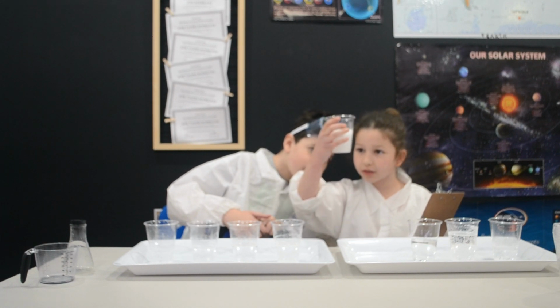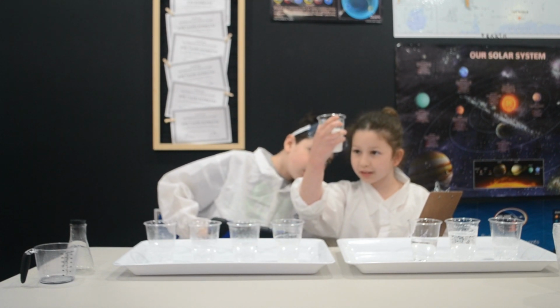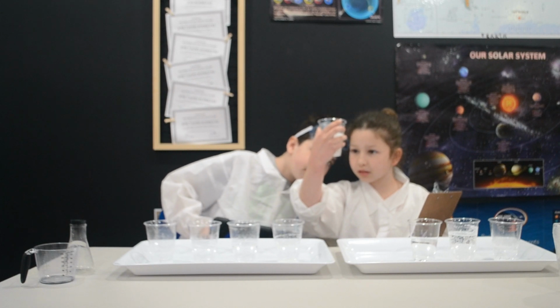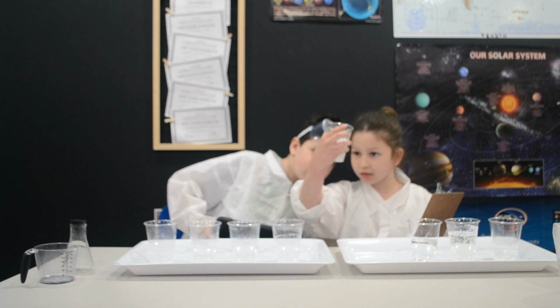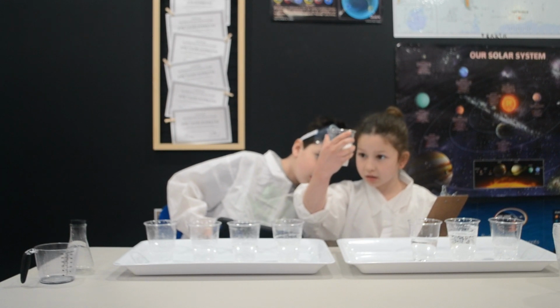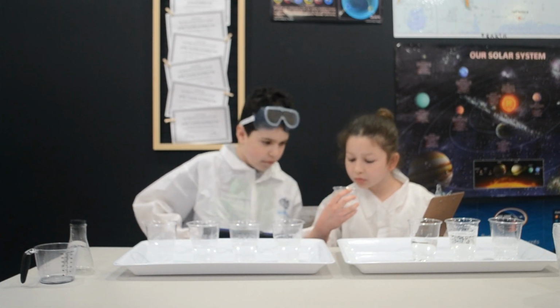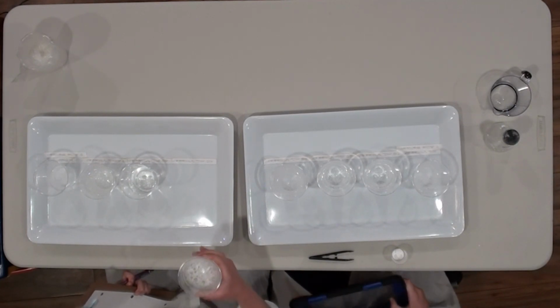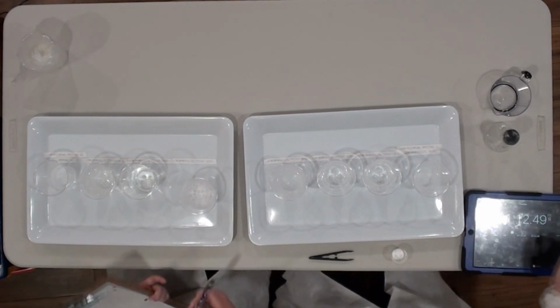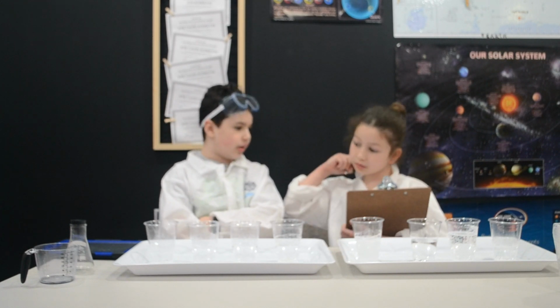It's like falling. It's moving sideways. Oh, where is it? Phew. Uh-oh, where is it? I don't see it. It's there. I think it's done. Yeah? It's done. 72 seconds. 0.49.